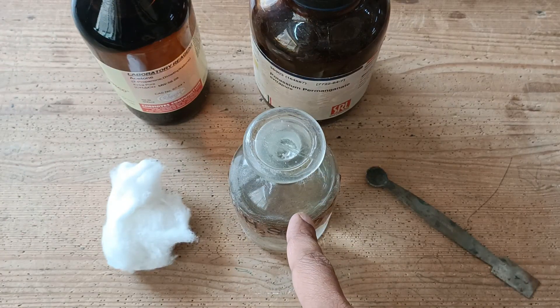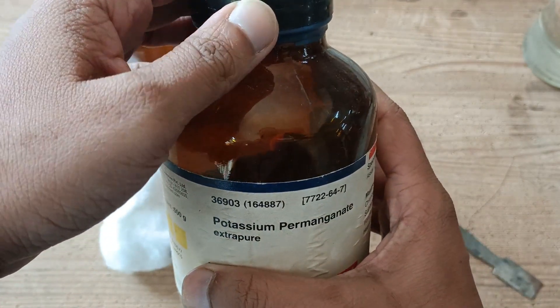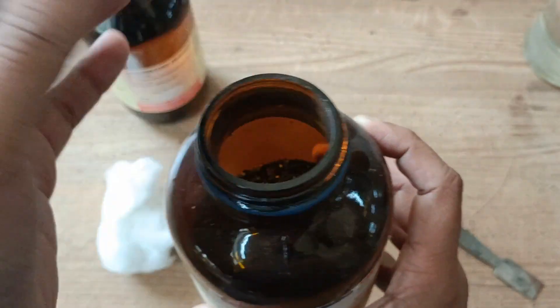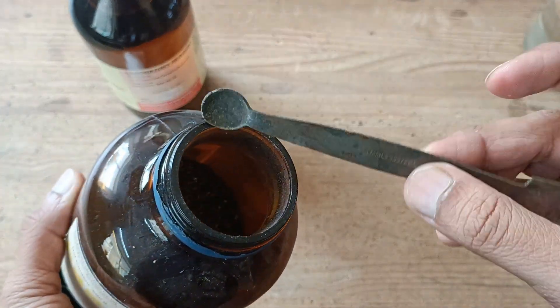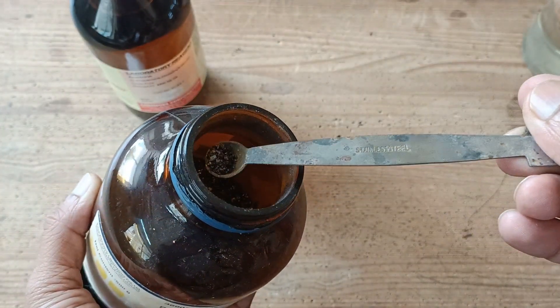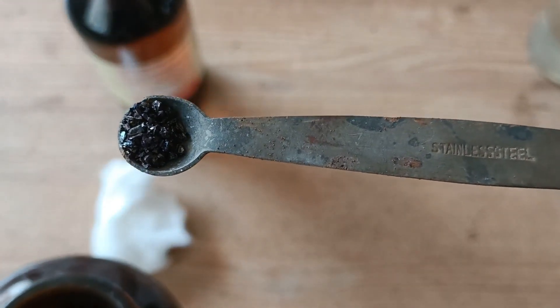We will also require potassium permanganate, KMnO4, which is available in the form of dark purple crystals.